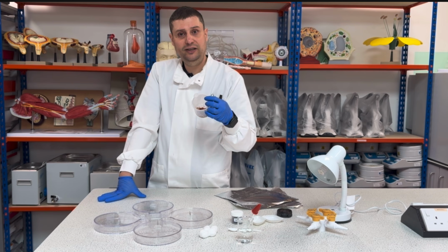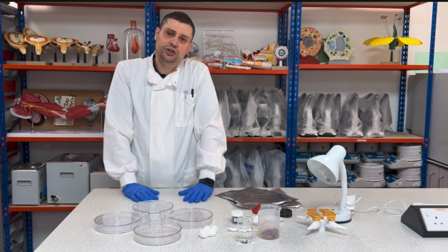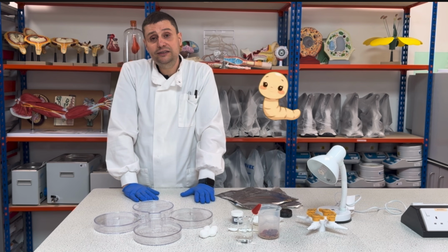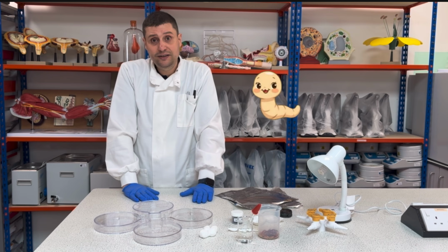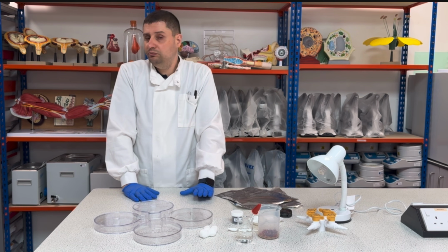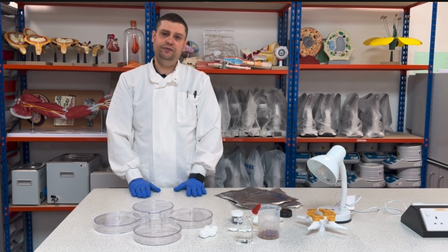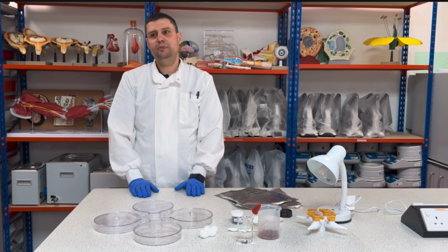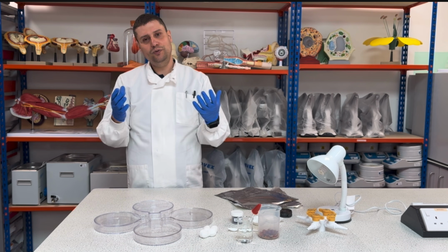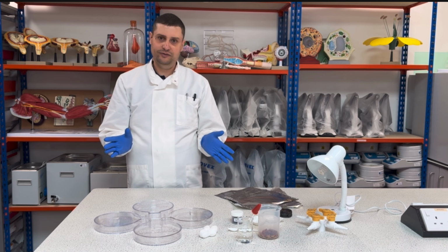Here we are using maggots, but the original design of this practical is with woodlice, but maggots are easy to find and way cheaper than woodlice, so they work the same. Any kind of invertebrate, especially the ones that live under rocks or in dark places, will work just fine.